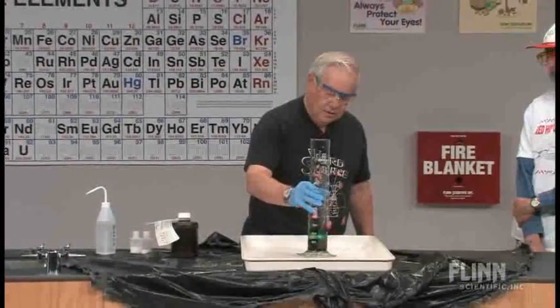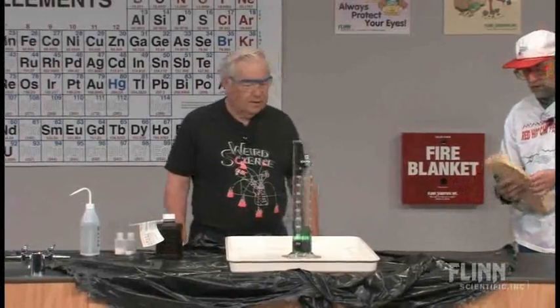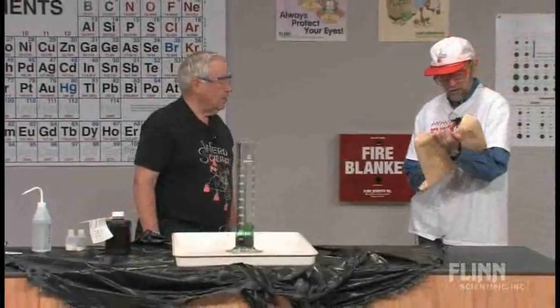Okay, we'll do that a little bit. And now, I need a catalyst. I think I've got one right here, Dwayne. You've got a catalyst? I do. Look at this.